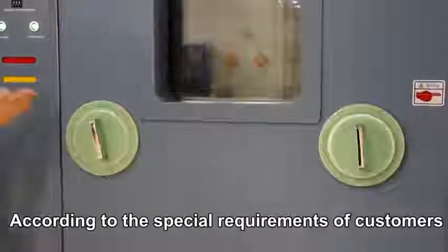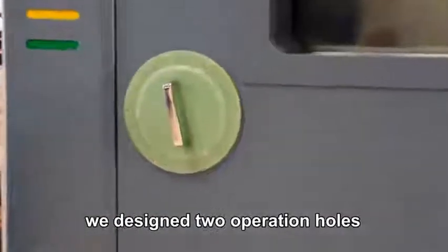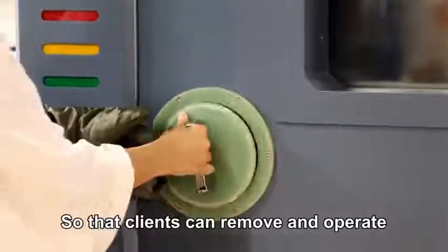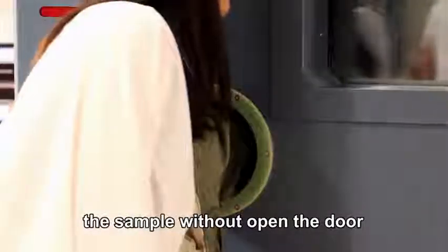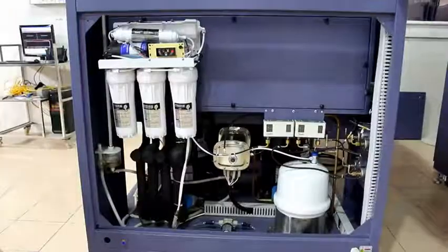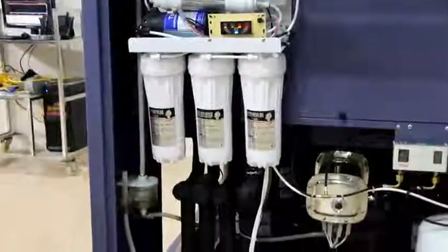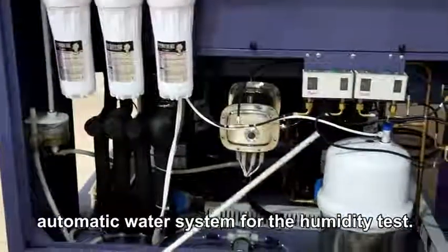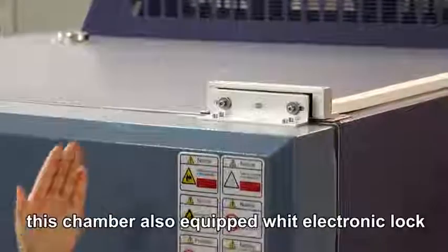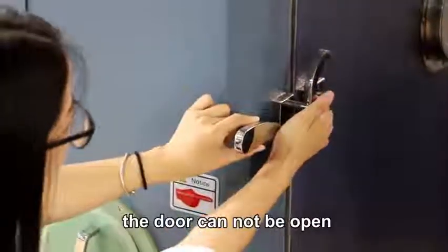According to the special requirements of customers, on the door of this chamber we designed 2 operation holes and equipped them with 2 heat-resistant gloves, so that clients can remove and operate the sample without opening the door. In addition, this chamber is equipped with a 5-stage auto purifier, an automatic water system for the humidity test. According to customers' requirements, this chamber is also equipped with an electronic lock, so that during the test the door cannot be opened.